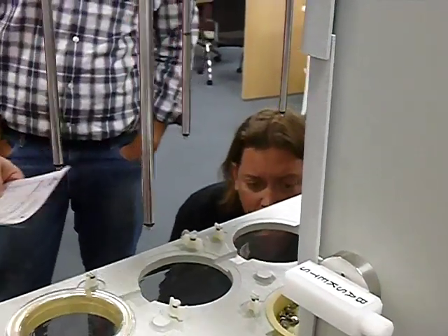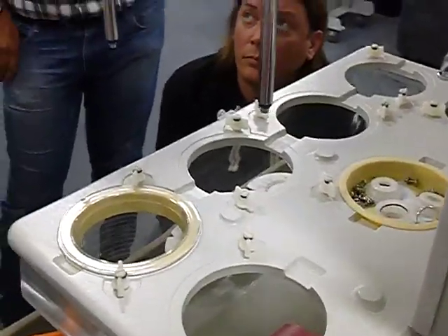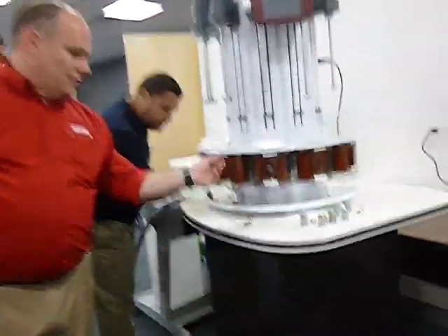A verification of the heater enclosure. As I talked to you over there, we talked about the heater enclosure. This was a 6100. You need to check the integrity of the heater enclosure. You just make sure that the wires are attached to it, there's no frayed wires, and it doesn't look like it's cracked. That the springs in the front are fine. These are still working good.